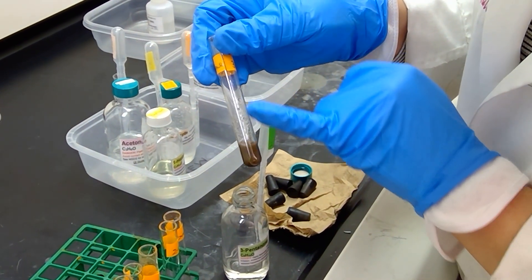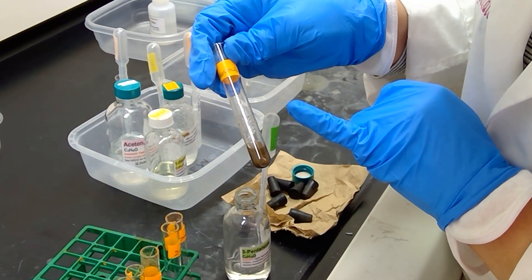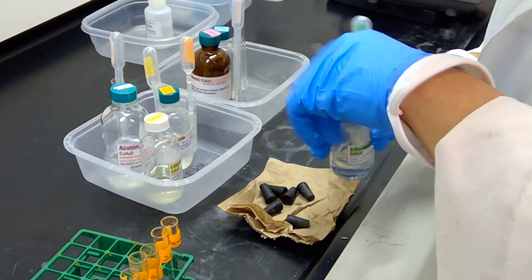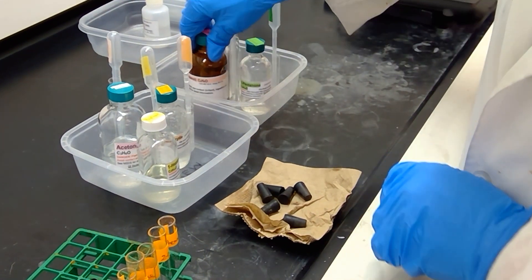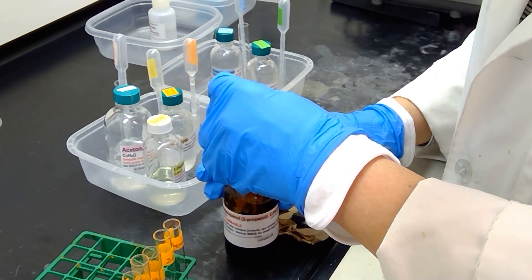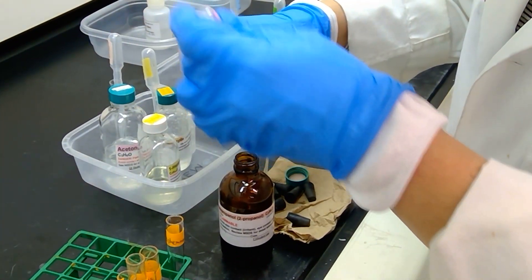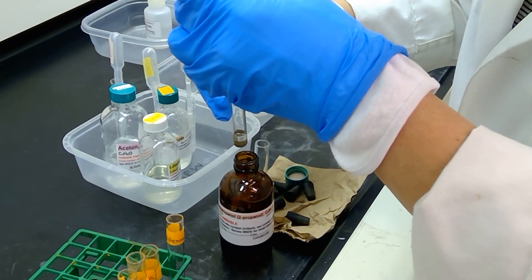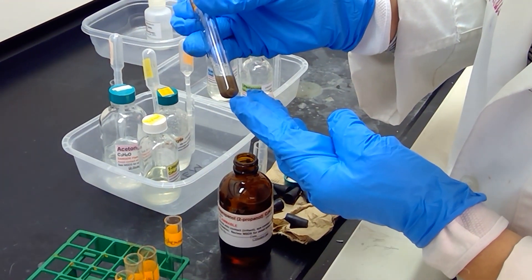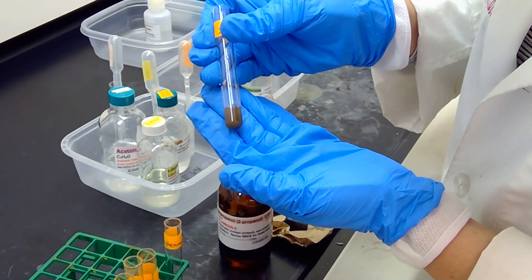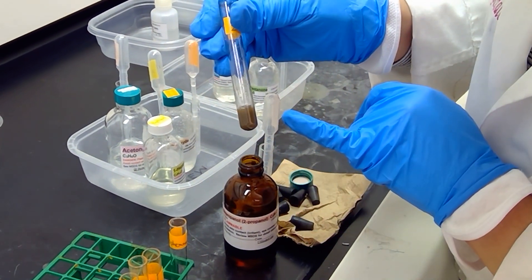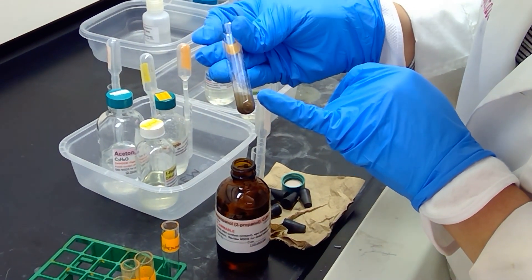All we see is wetness and moisture happening on the inside part of the test tube. Let me move on to the next sample, which is 2-propanol. 2-propanol is an alcohol, so we do not anticipate a reaction here, but it's one of the samples we are testing. Let's take a look. Looks like no precipitate, and our solution is staying as it was.